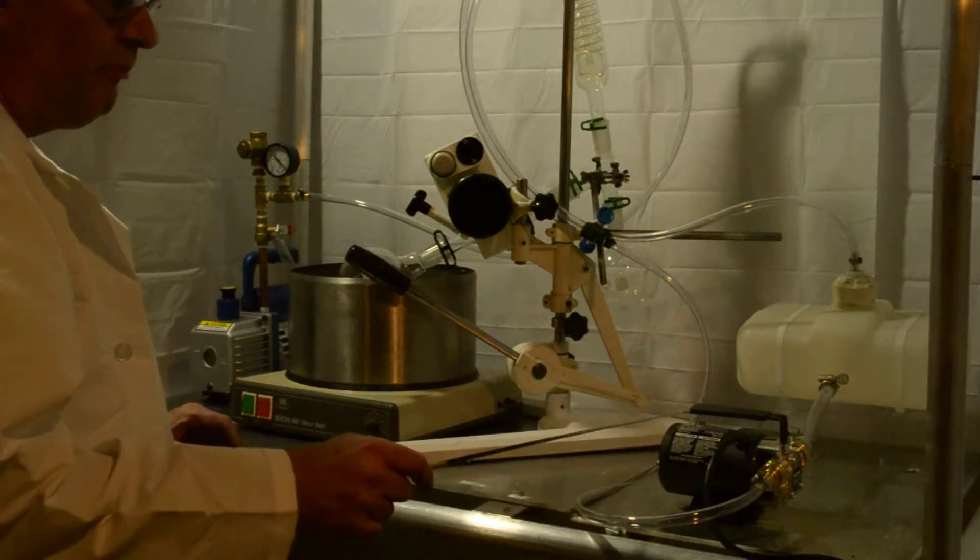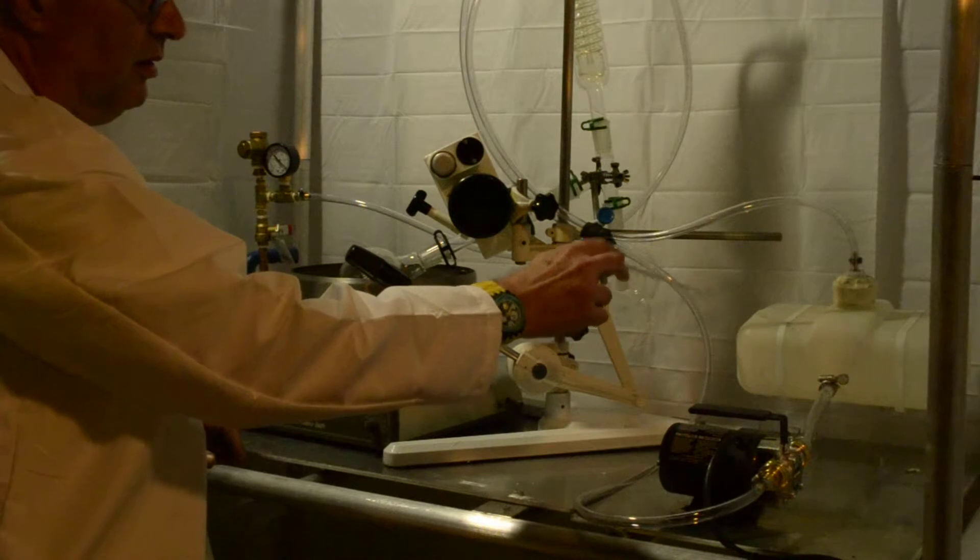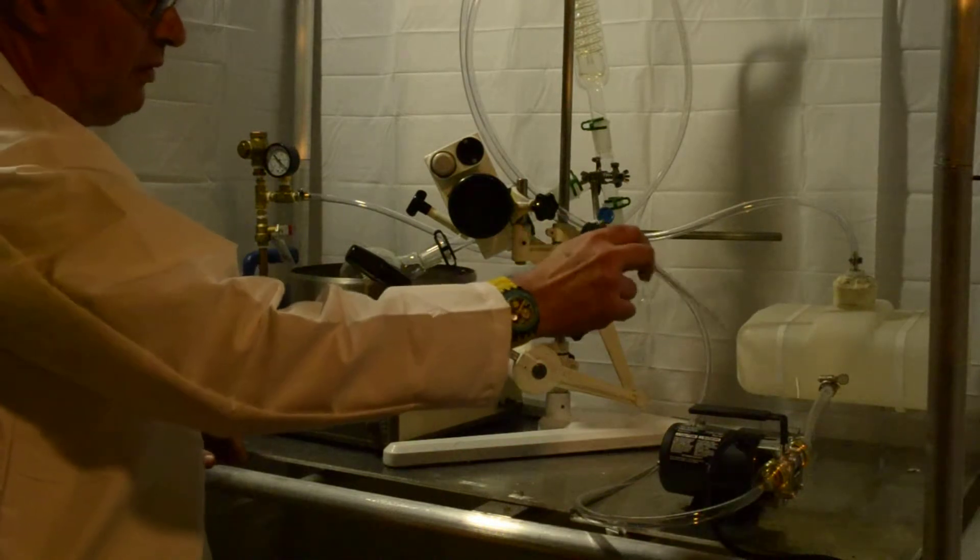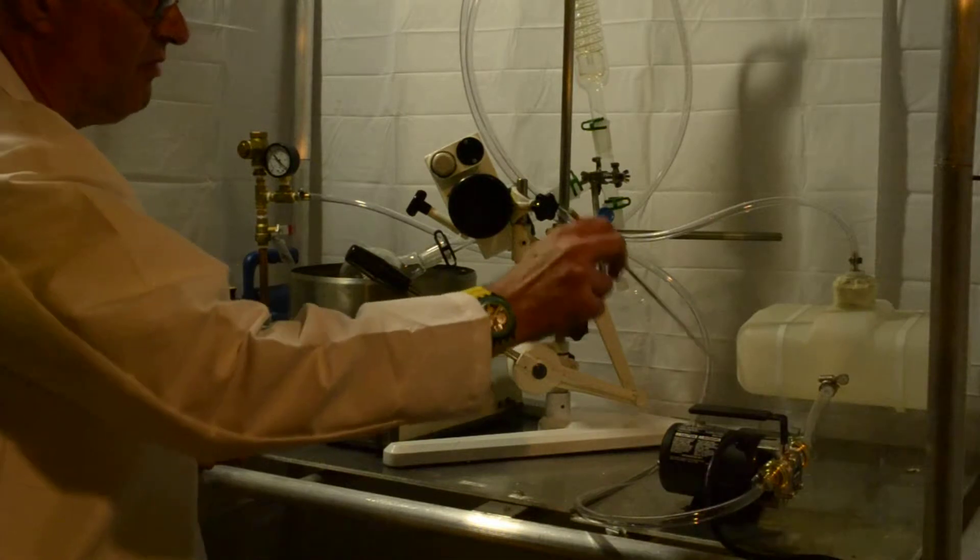Here we have the water pump, your tank, hook up your lines, make sure and clamp them all off nice and snug.